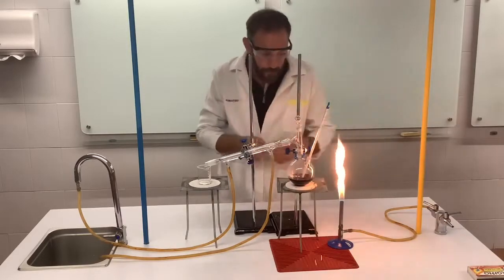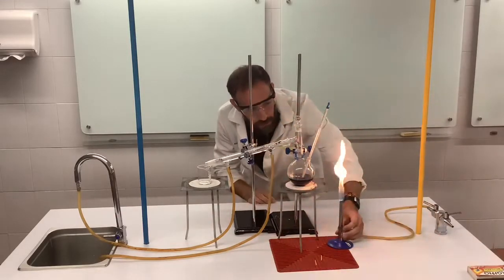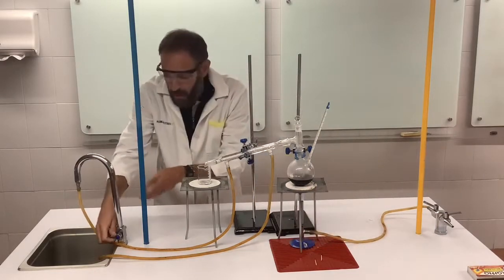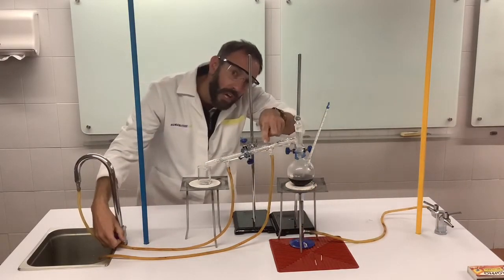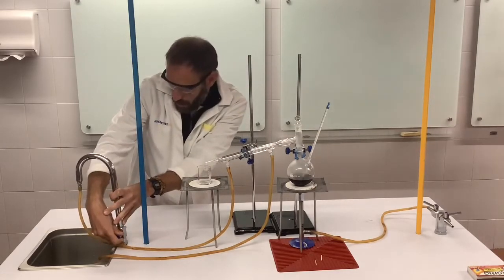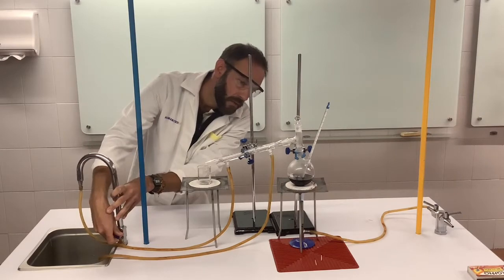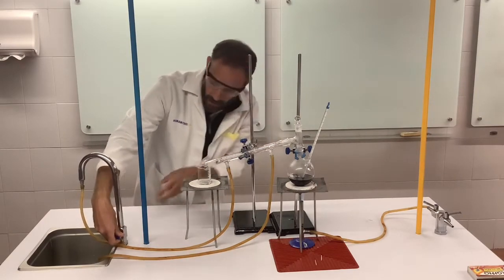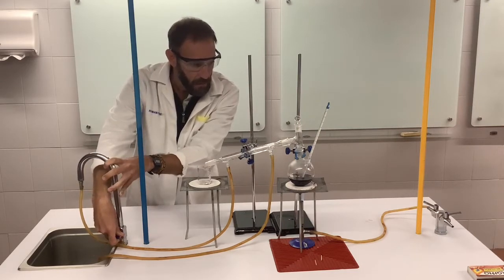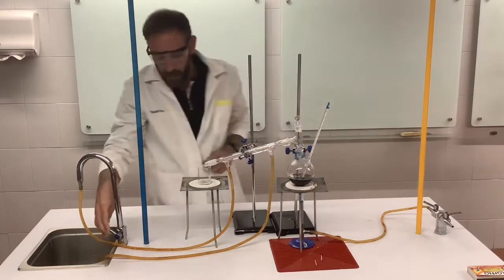So let's begin. I had it on the safety flame, as you know, and let's turn it on to the blue flame, get that nice and hot, and then let's put that under there. Over here we have the tap, so we're going to control how much water runs through there, and you've got to be careful because sometimes you can put it on too strong. So here we go. Okay. So maybe you can just see the water in there going through it. Just so you can touch it to see that it's cold. That feels cold enough to me.